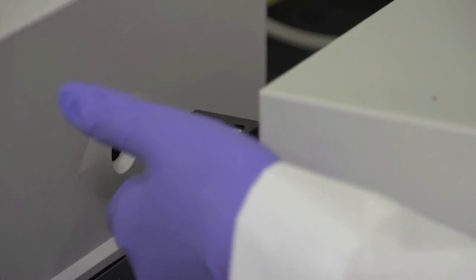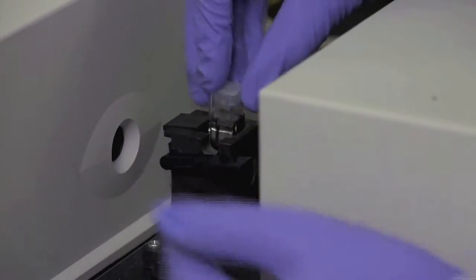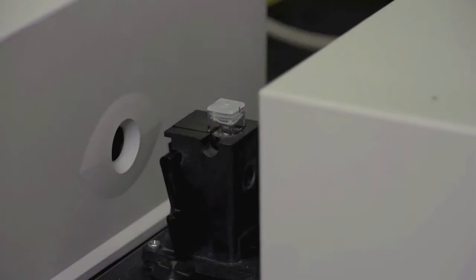Make sure that the arm is up before you place the cuvette into the sample compartment chamber, and then press the arm down to lock it in place.